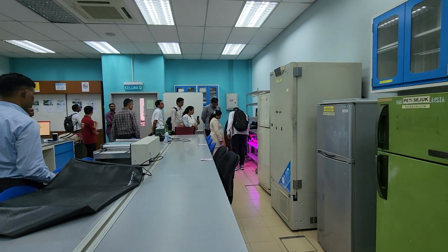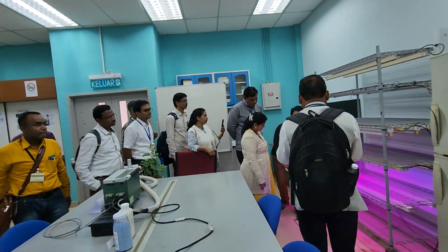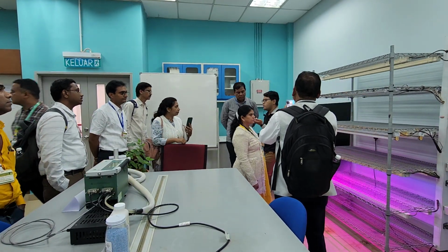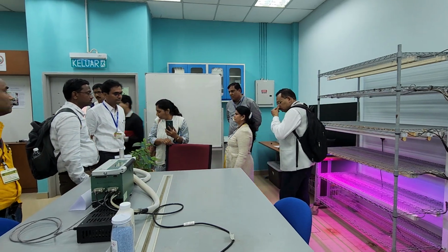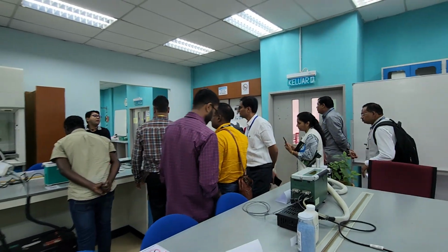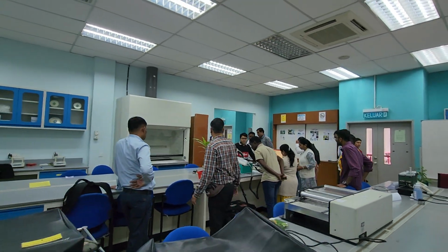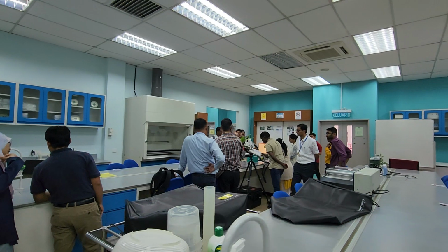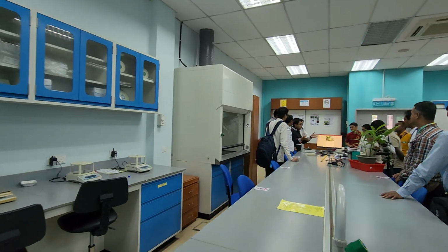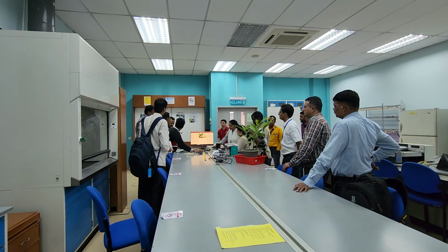And if it goes closer to the light source, you're going to get a bit more. Sunlight also, yes, in sunlight also you can. Because it reads whatever is between 400 nanometer to 700 nanometer of light. This nanometer range corresponds to specific colors that the retina in our eyes can perceive. The colors in the universe are so many, from 0 to infinity nanometer, but God has created our retina to see only visible light.